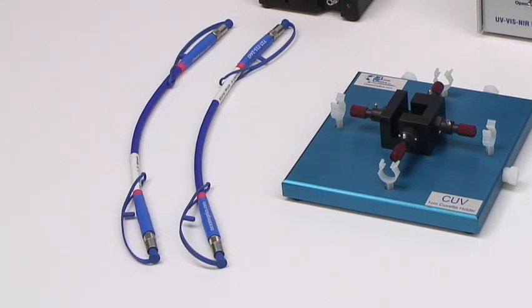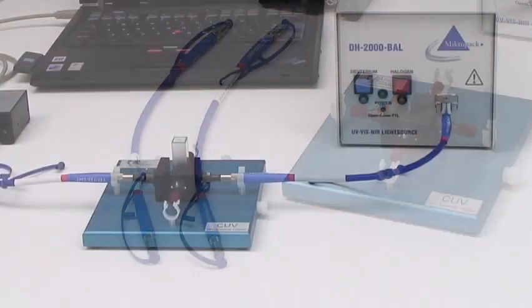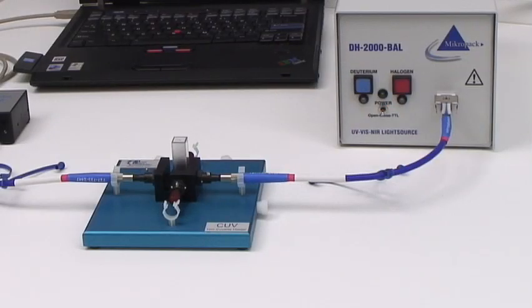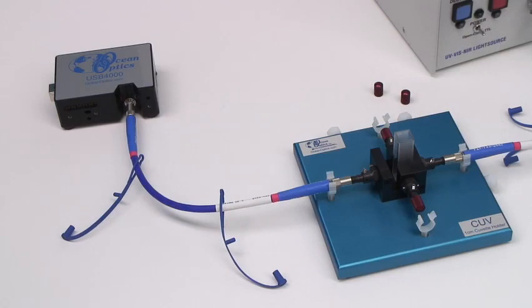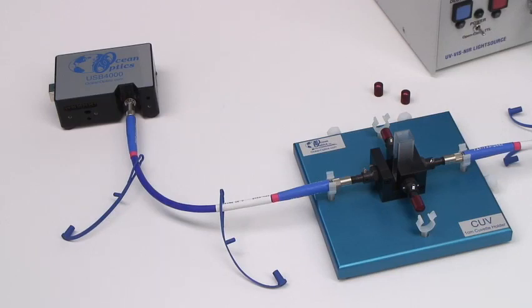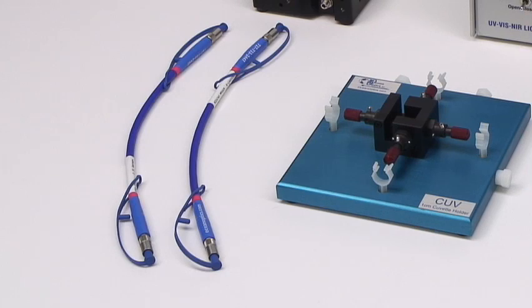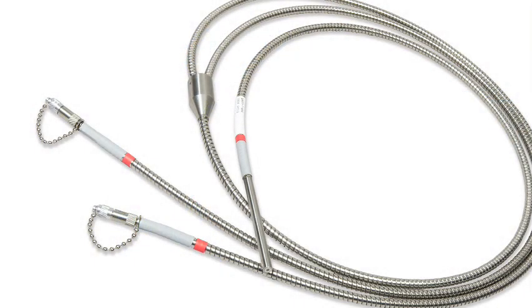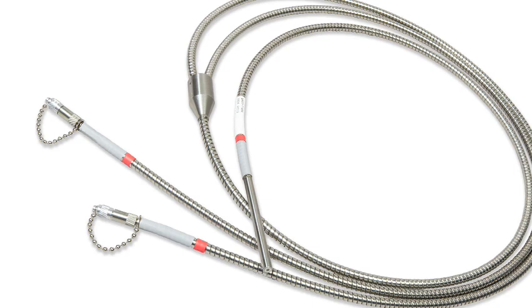We'll also use two 400 micron optical fibers. One will transmit light from the light source to the sample. The other will transmit light from the sample to the spectrometer. We're using UV-Vis fibers here, but solarization-resistant fibers are also very effective for applications below 300 nm.